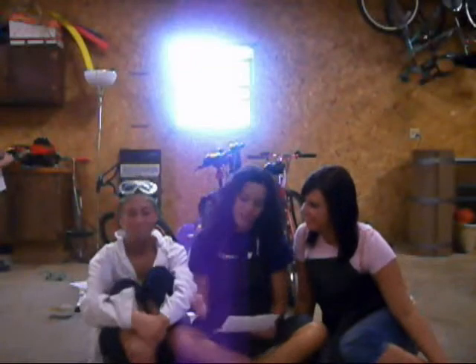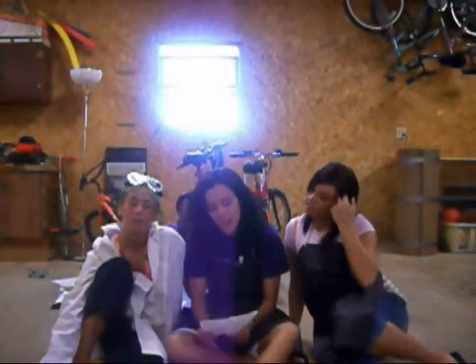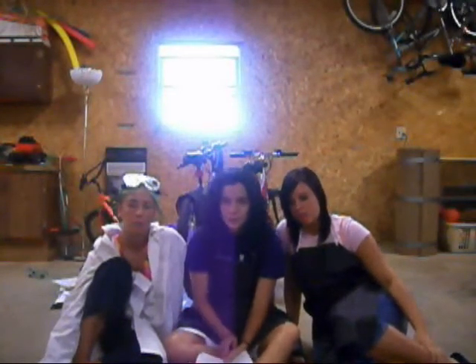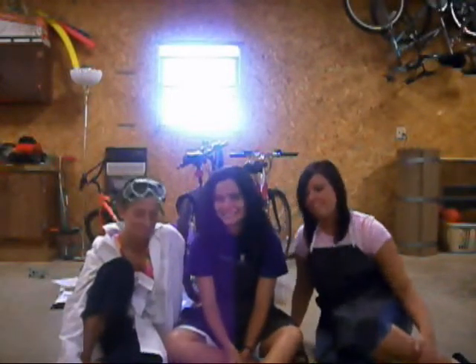According to the rules, I should have conducted myself in a responsible manner at all times during the lab. I should have followed all written and verbal instructions carefully, and I should have been alert, and I should have proceeded with caution at all times in the lab. And I should have notified Mr. Sully right away when I spilled the chemicals. Very discreetly, I might add.